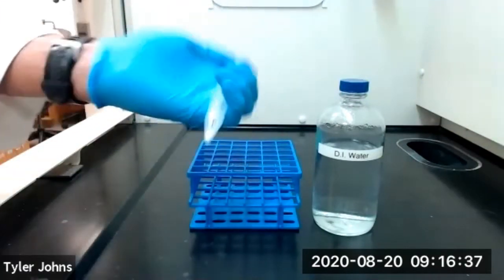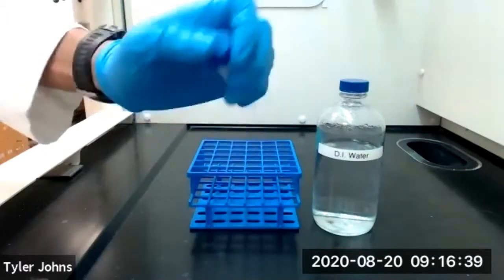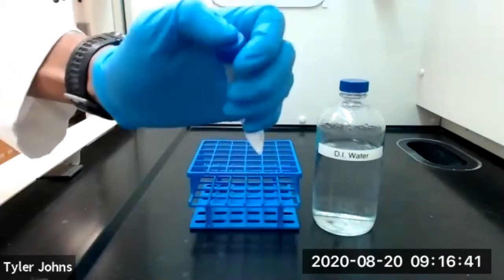We'll need to shake our tube for several minutes until the caffeine has completely dissolved.